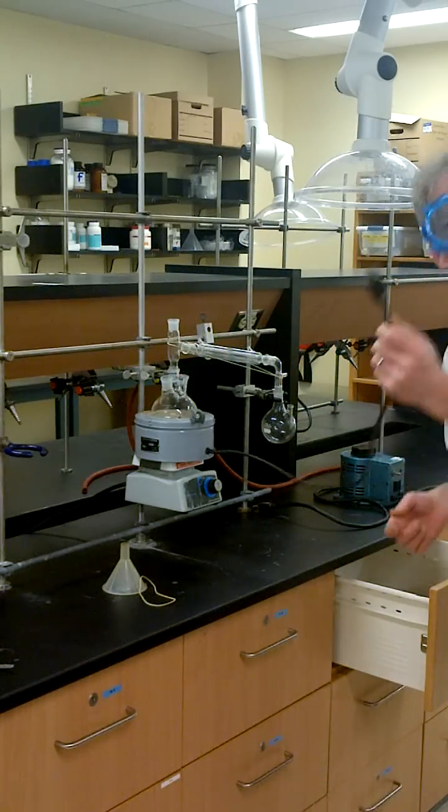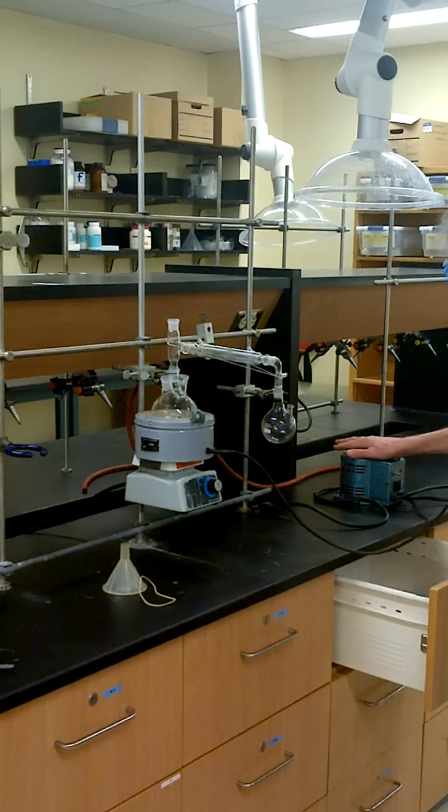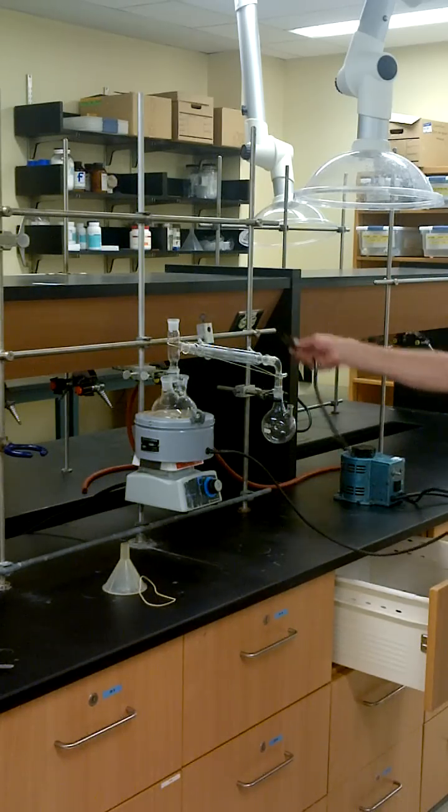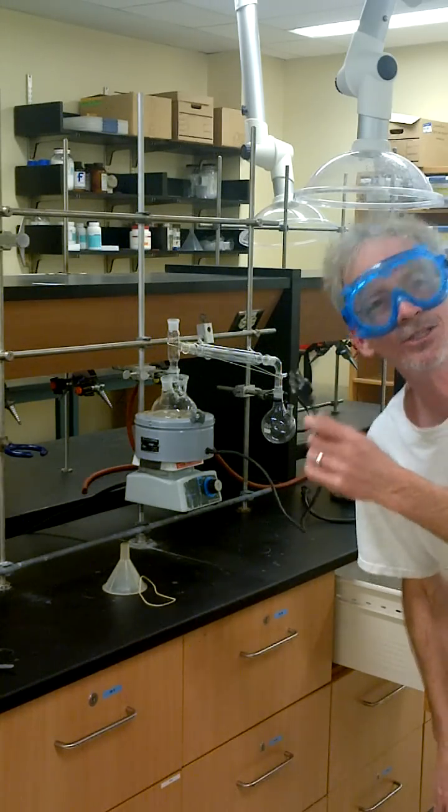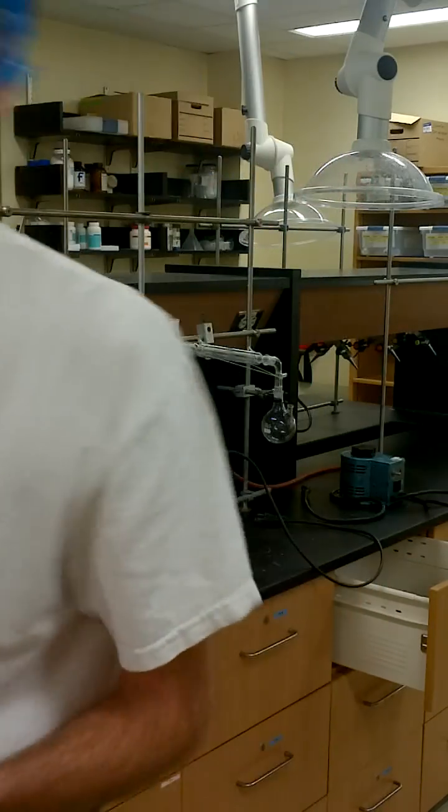This heats, and remember, this gets plugged into this thing. This goes in the wall. Do not, please do not plug this into the wall. That is your equipment setup for experiment number two, CHEM 2700. Here we go. Have fun!